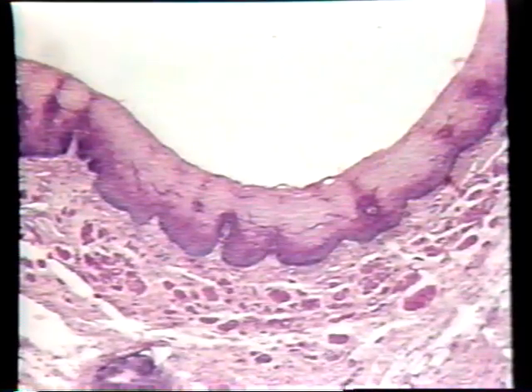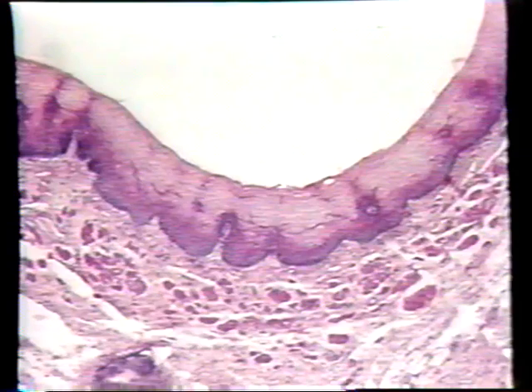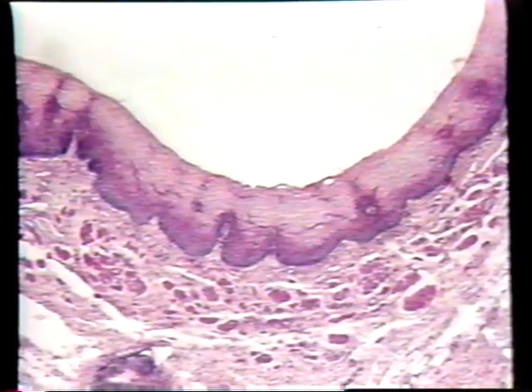We're going to look at a different kind of epithelium now, the so-called stratified squamous epithelium. And stratified squamous epithelium is, first of all, a stratified epithelium, which means it is many cells thick. And second of all, the cells that comprise the uppermost layers are flat. Stratified epithelia are always named by the shape of the uppermost layer of cells, not by the general shape of the cells that are found throughout the epithelium.